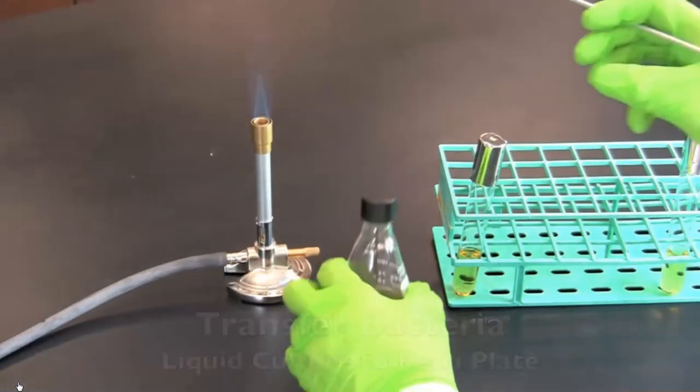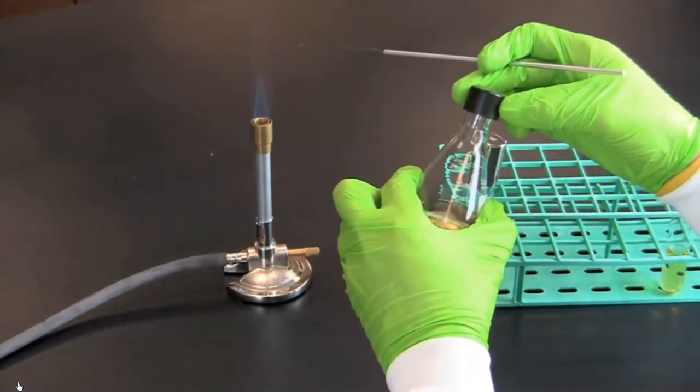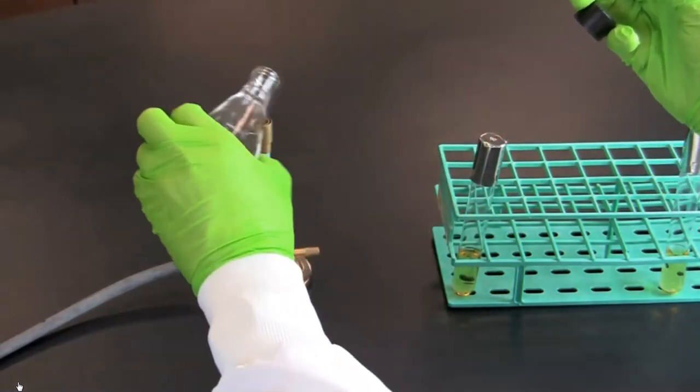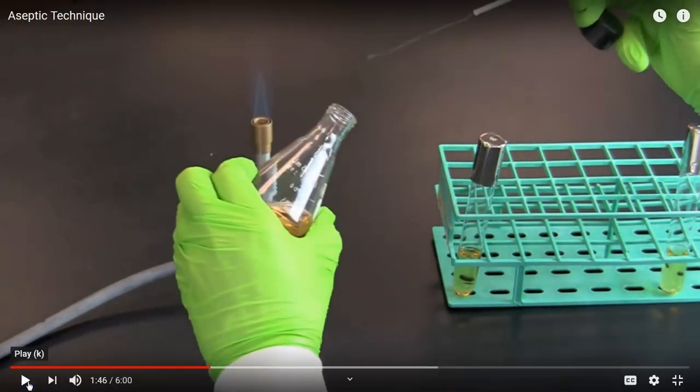In this section, you will learn how to transfer bacteria from a liquid culture to a petri dish. After flaming a loop, take the lid off the container of liquid culture and pass the mouth through the flame. Then dip. Really quickly, why do you think the demonstrator is holding the cap from this bottle in between his ring and pinky finger?